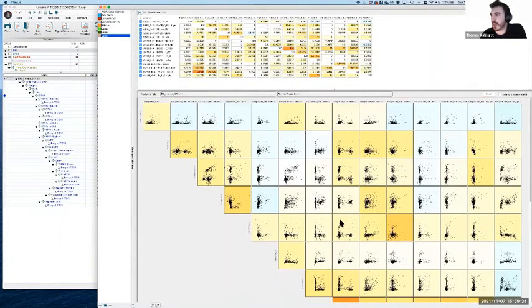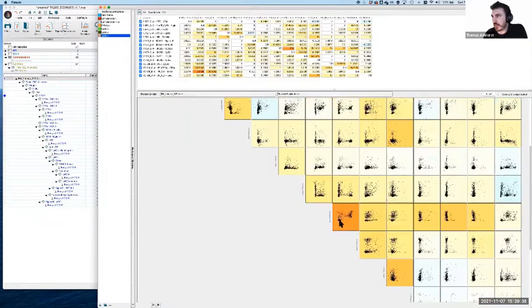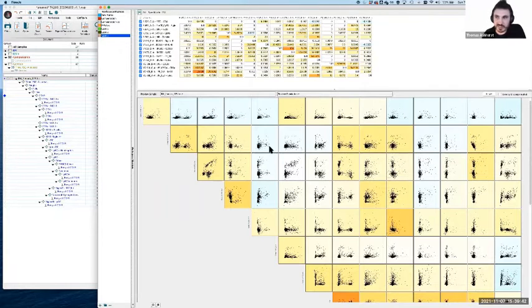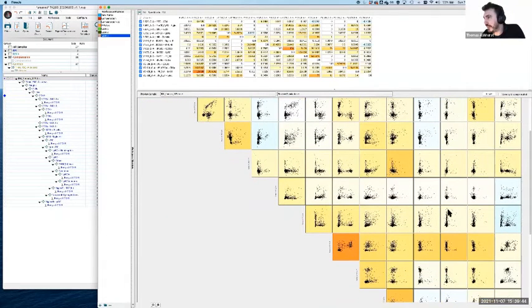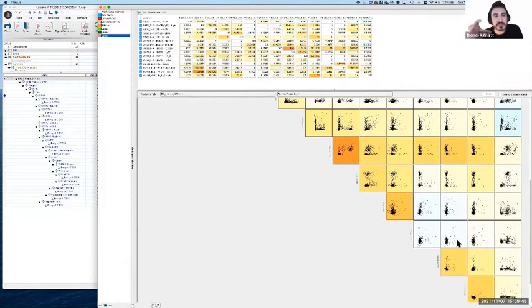It's not confusing, but I think what it is, it's just the cell density. It makes a decision about how many events it's going to plot, and just sticks with it. And so often I have times where I struggle to see if it's low frequency events, and you sort of think, oh man, I don't know.